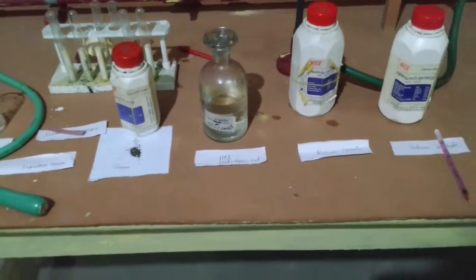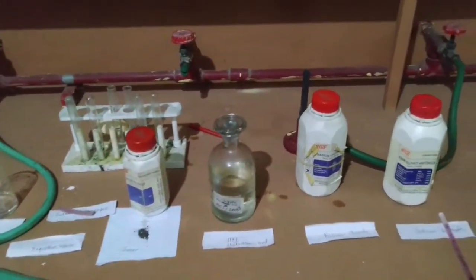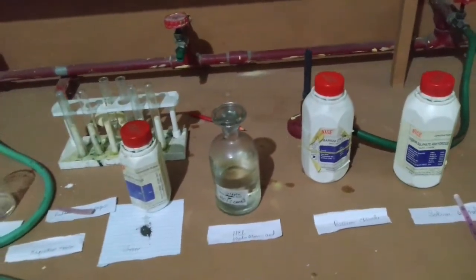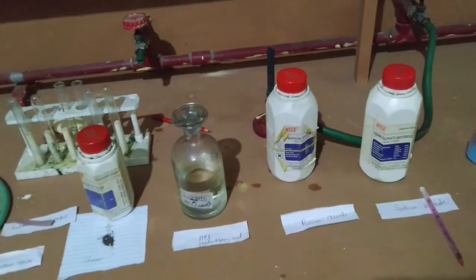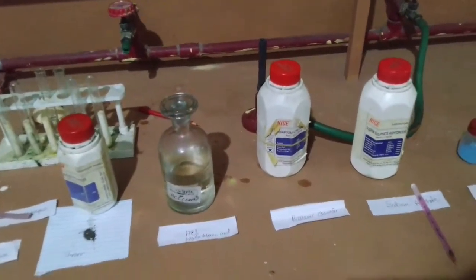Good morning students. As you can see, today I have so many chemicals in front of you. So now you can get an idea that today we are going to perform experiments that are given in your syllabus.